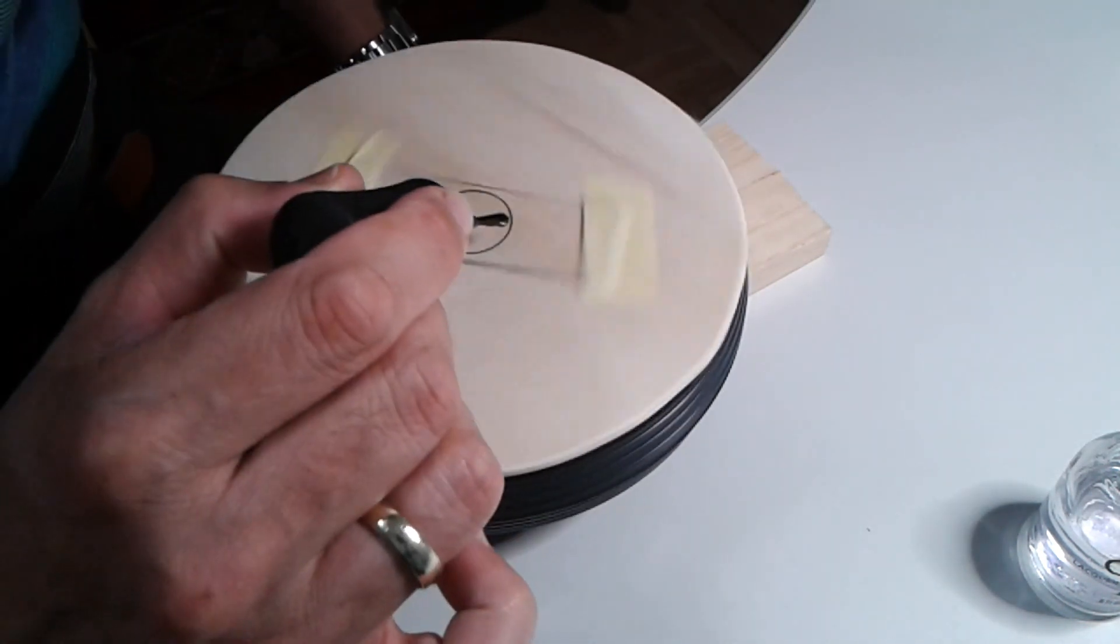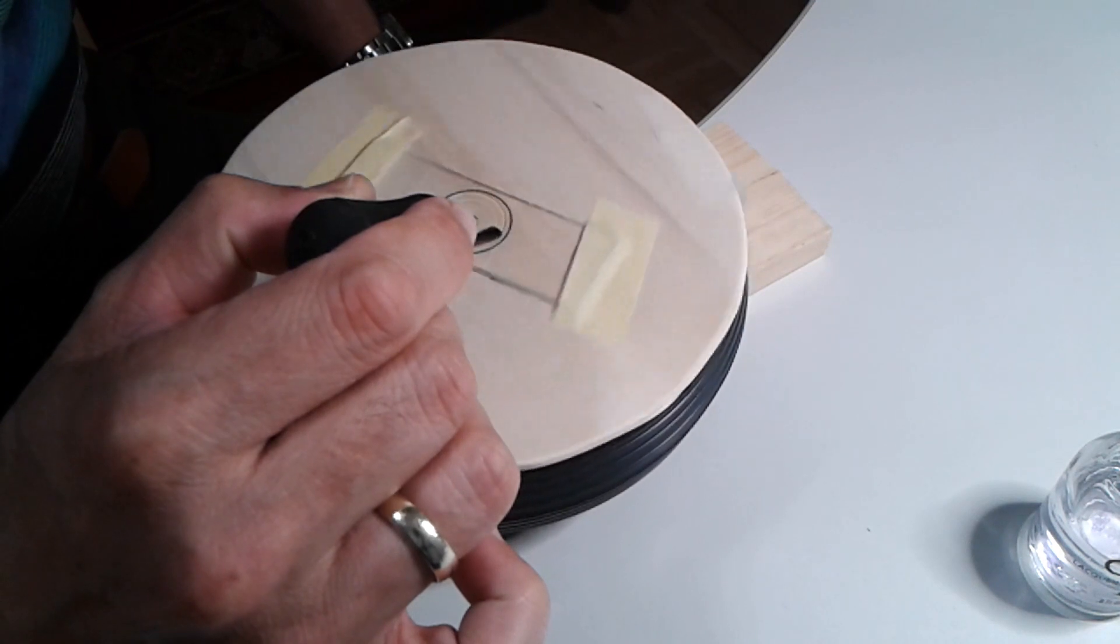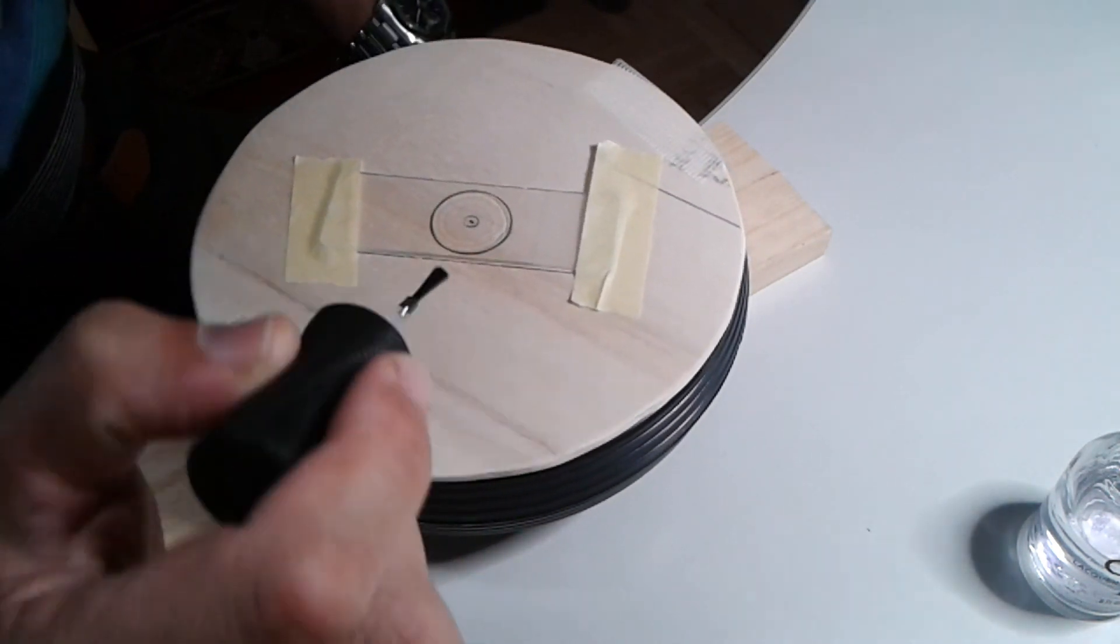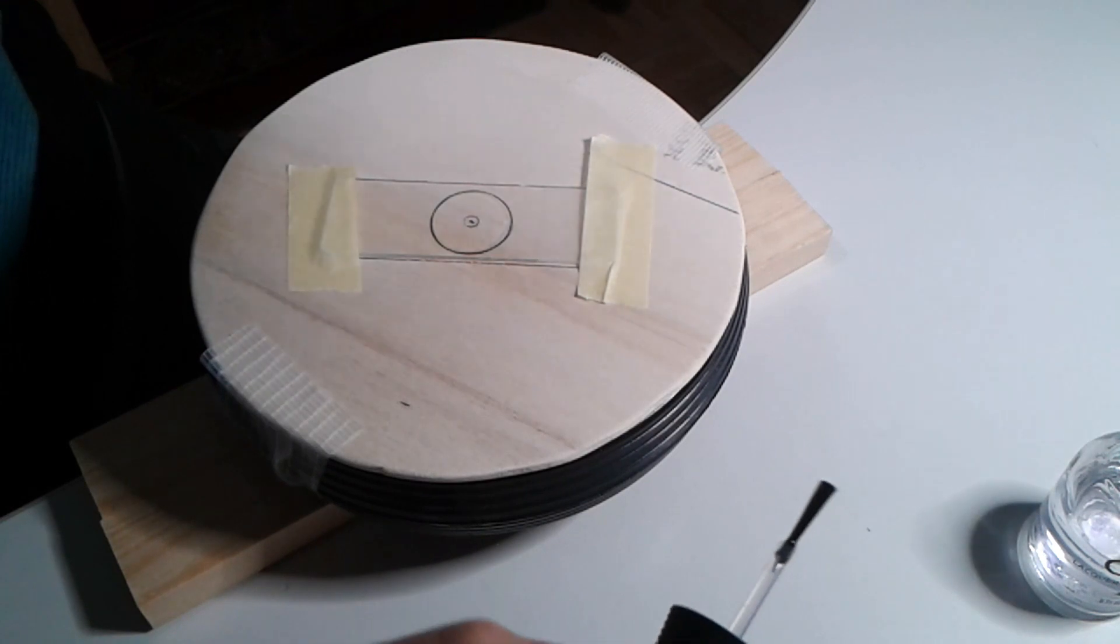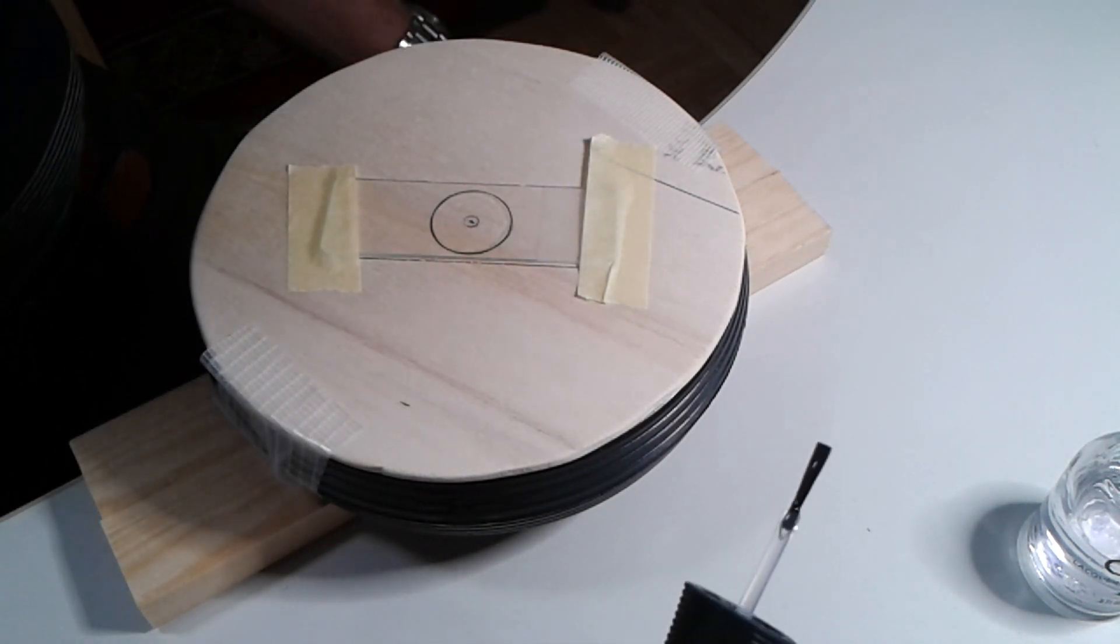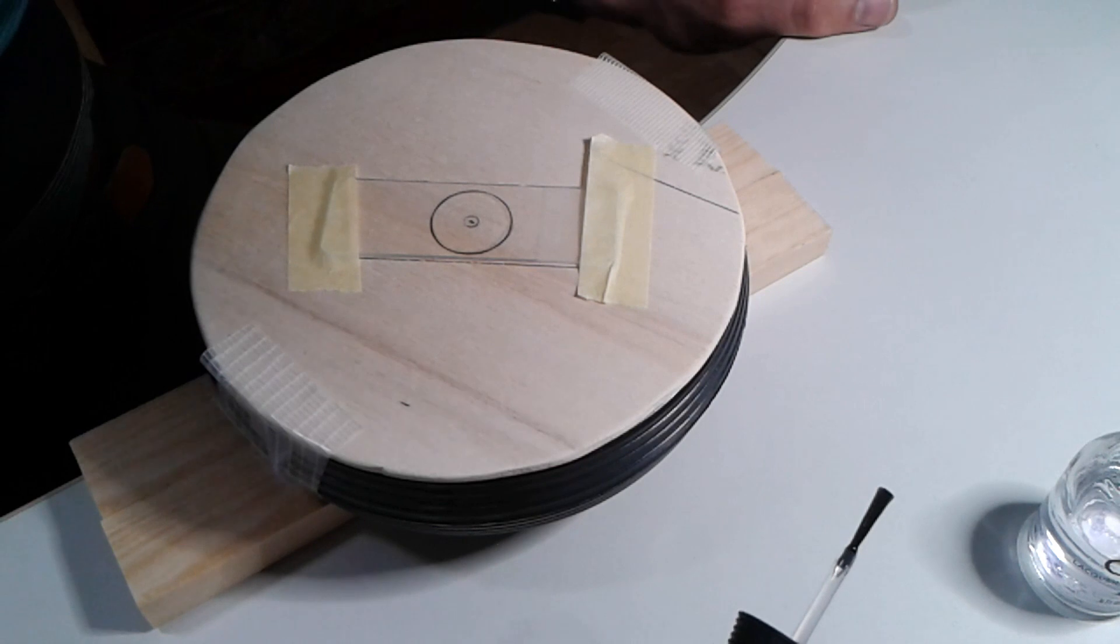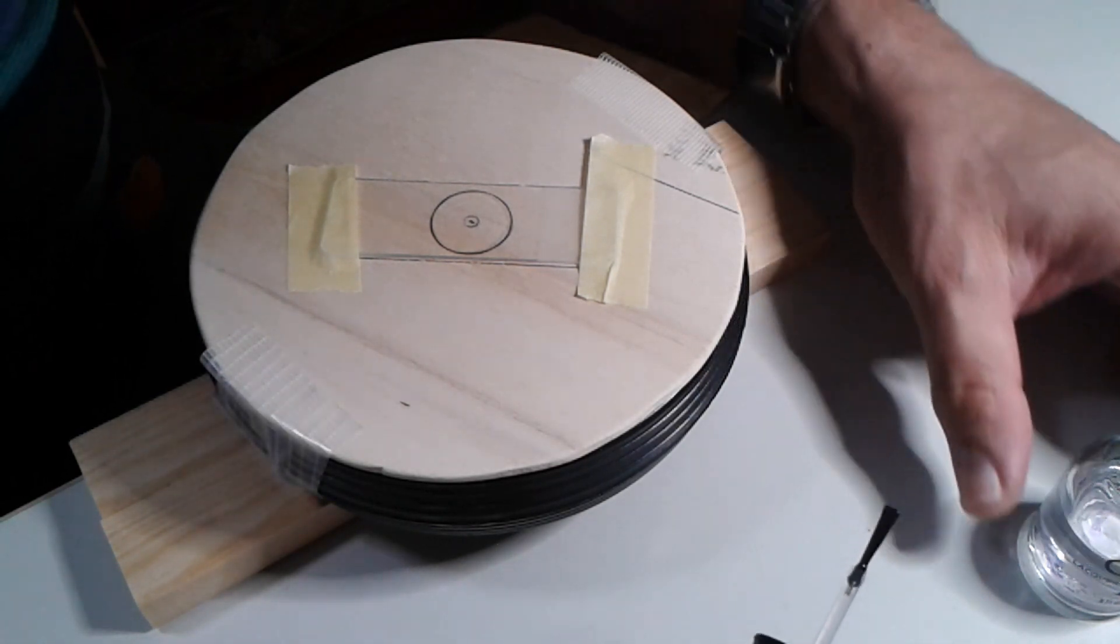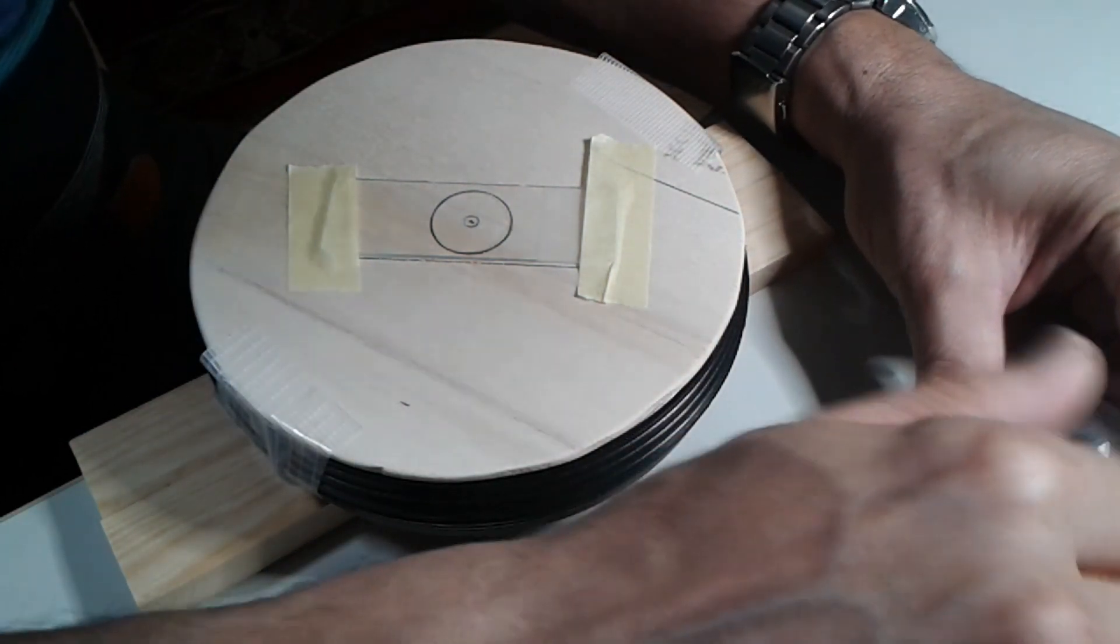Let's try to apply a little bit. I don't know if this works. It seems to be okay. You don't see this quite well because clear nail polish is harder to see. Normally you would probably use black nail polish or any other color which makes it more visible.